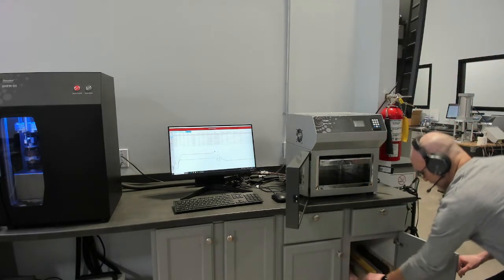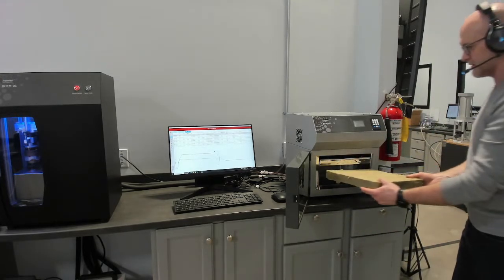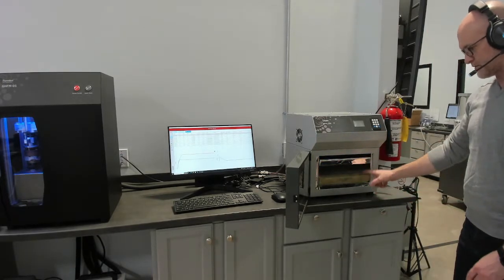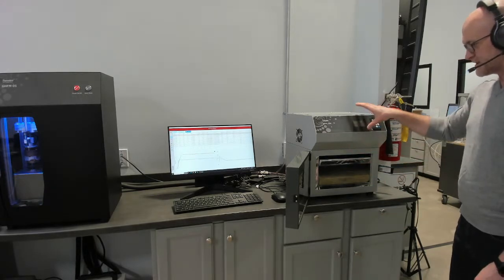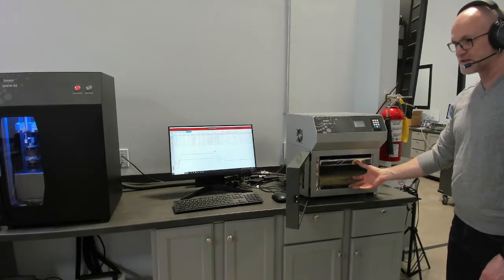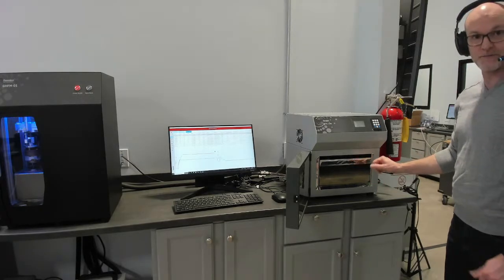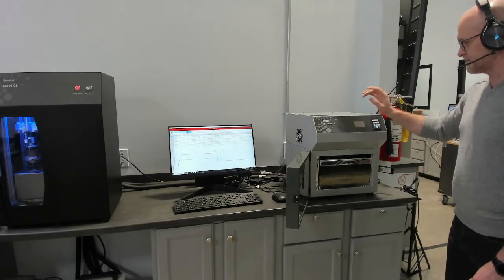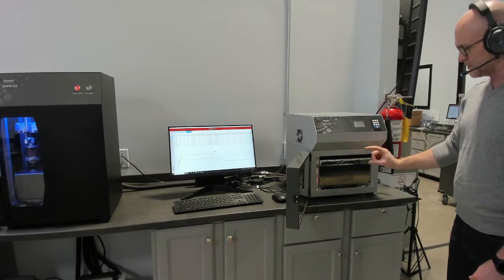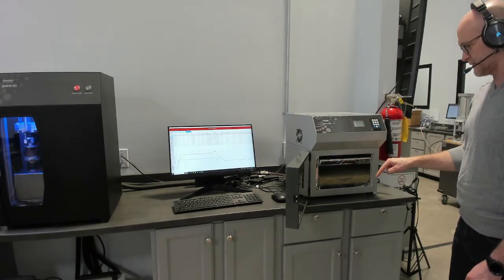It's generally used for materials that are heterogeneous and used on a macro scale that can be inserted, and the two plates come together and you get the thermal resistance and thermal conductivity. This is one size, our HFM100, where the number stands for the thickness. The opening is 100 millimeters thick. The sample size of this model is 300 by 300. The other model we have is HFM50, which is a 50 millimeter opening, and the other dimensions are 200 by 200 millimeter.